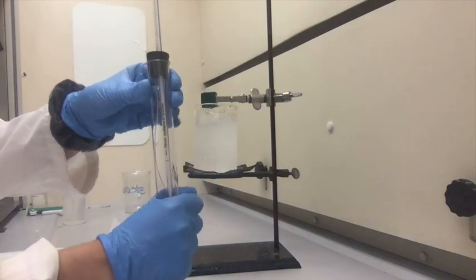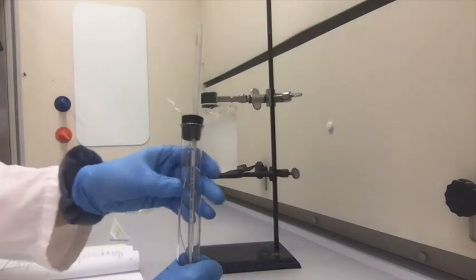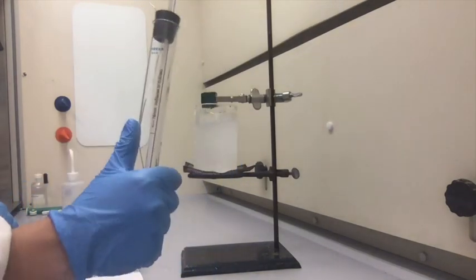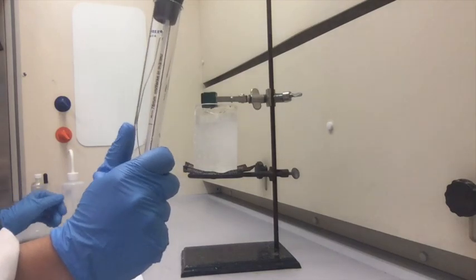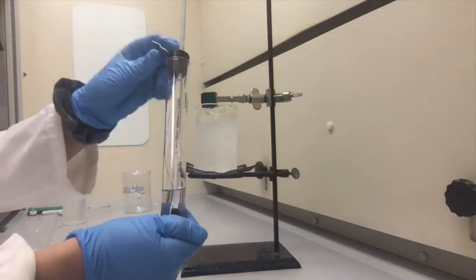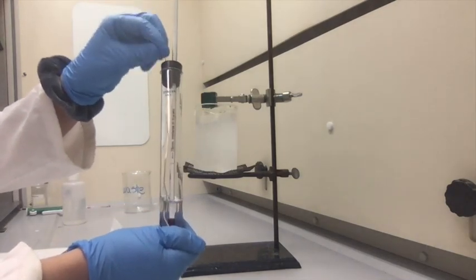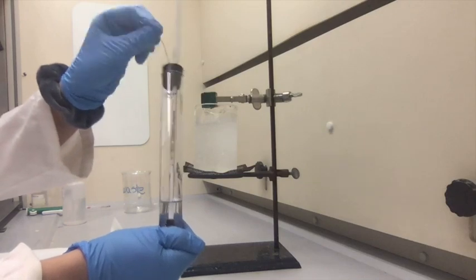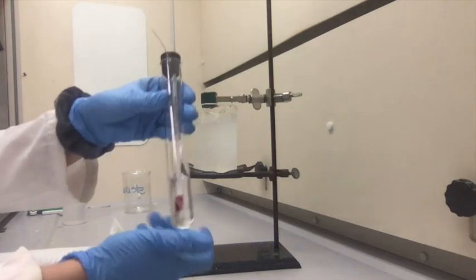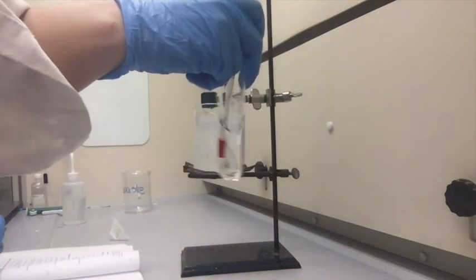We're almost there. All right, it's all melted again.